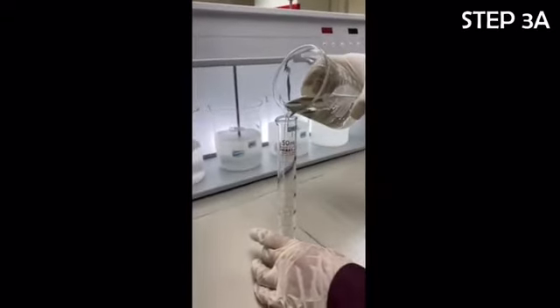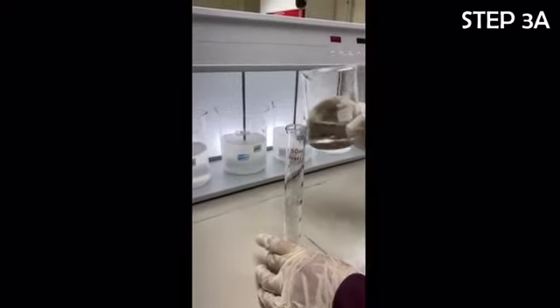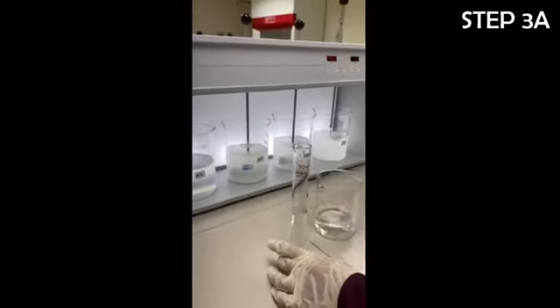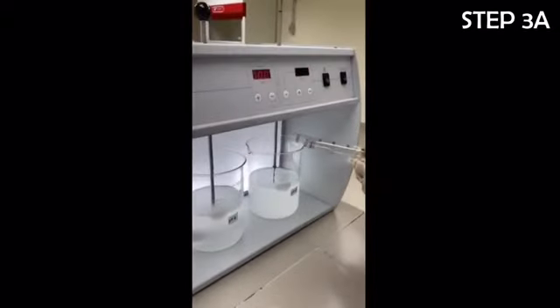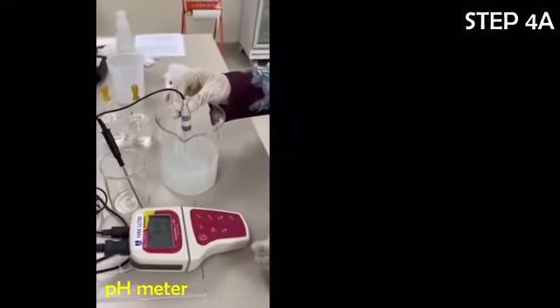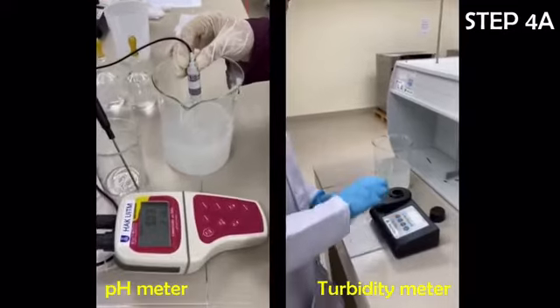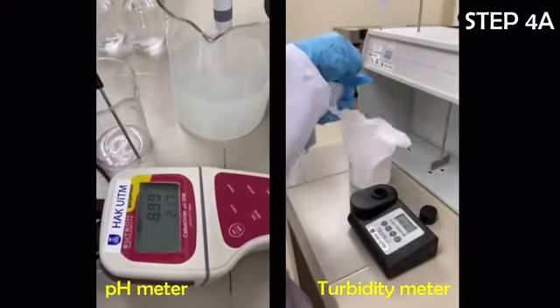Then, 30 milliliters of alum coagulant was added into each beaker. The initial pH and turbidity of the water samples in each beaker were measured using a pH meter and turbidity meter, respectively.